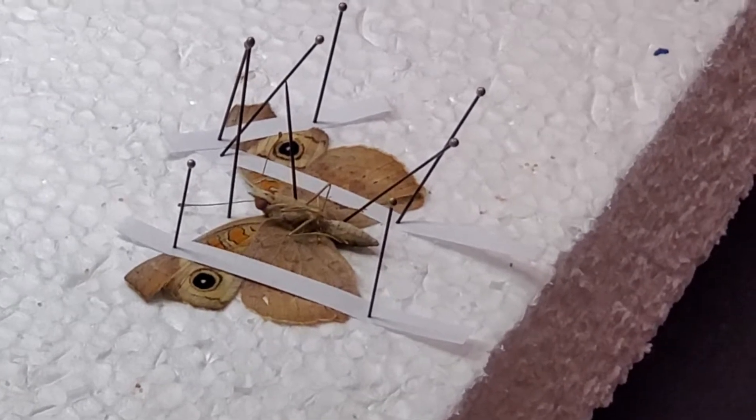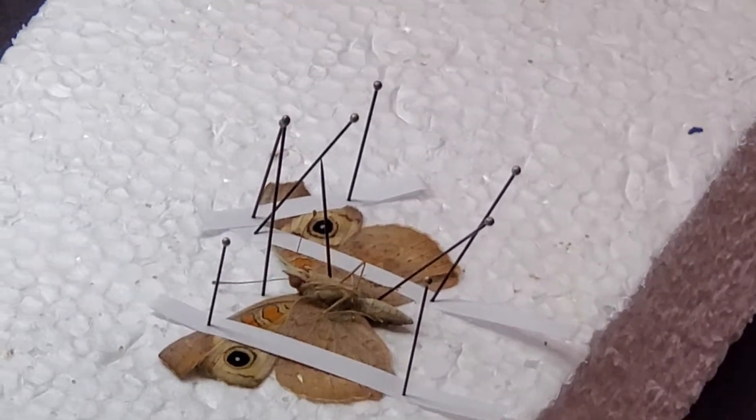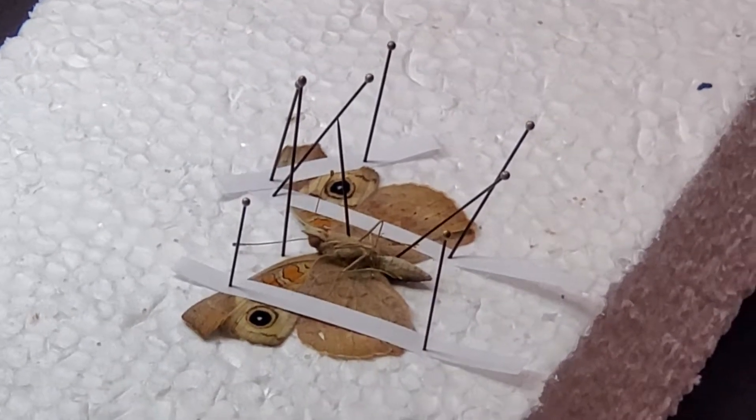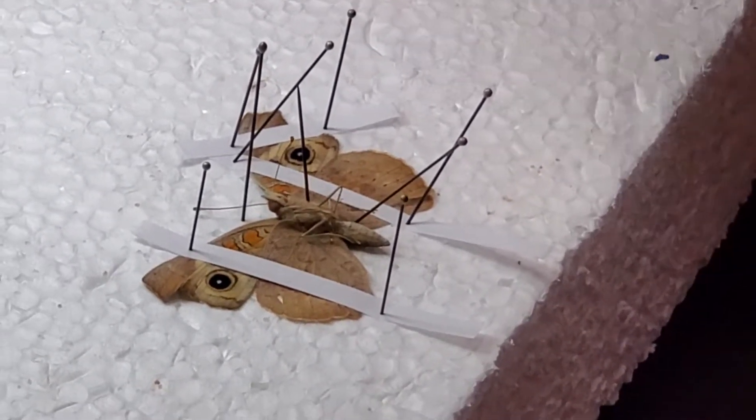If you are making a collection for a museum, you might use 50 pins and a whole lot more paper because every specimen you want perfect, because this is for public display. Exactly how you do it depends on what your goal is.